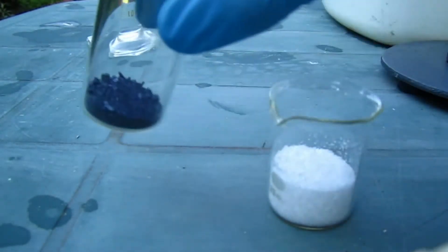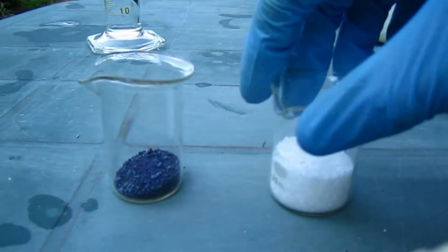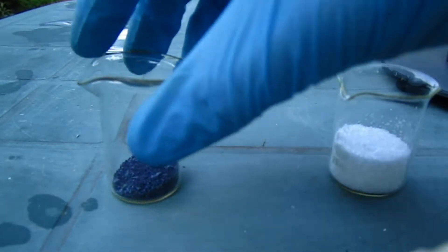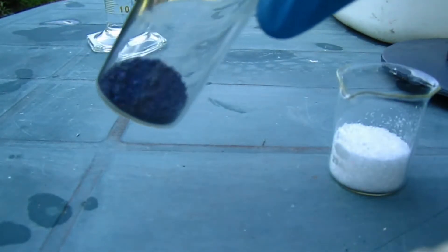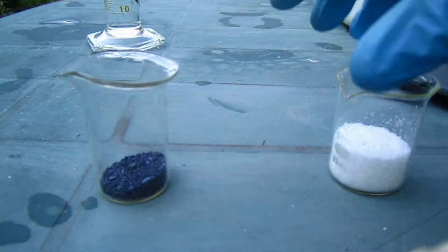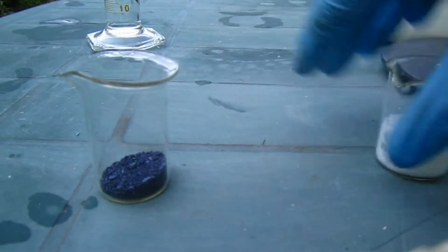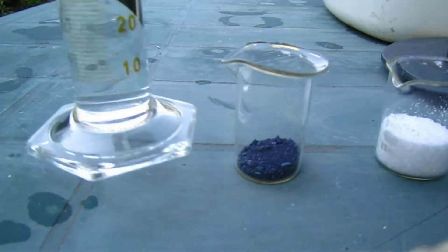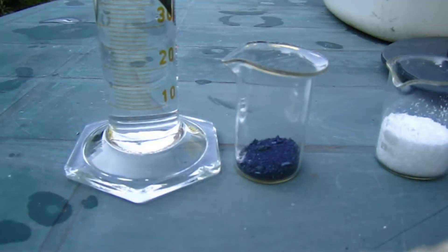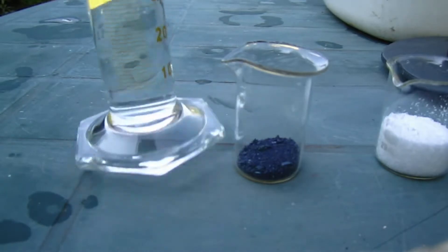So hello, in this video I'm going to make some m-chlorobenzoic acid, and for this I'm going to use some potassium permanganate, benzoic acid, and some 5.5 molar hydrochloric acid.